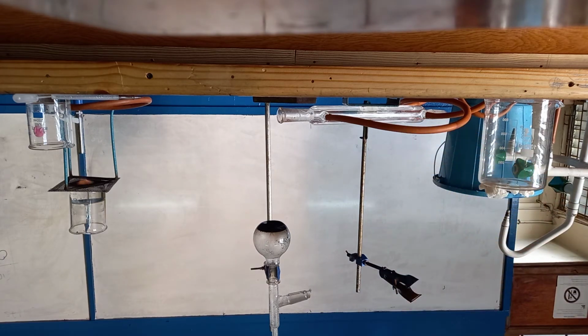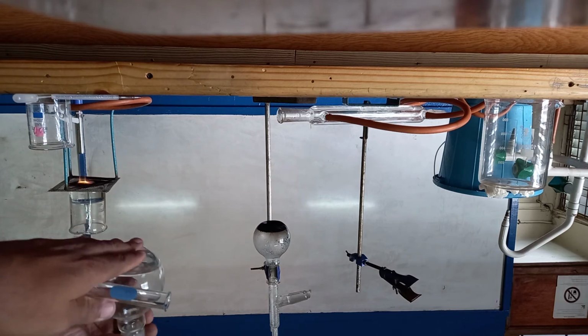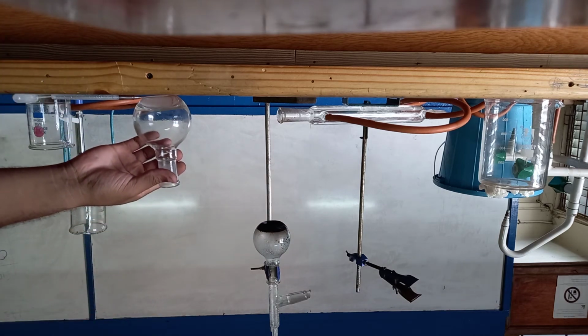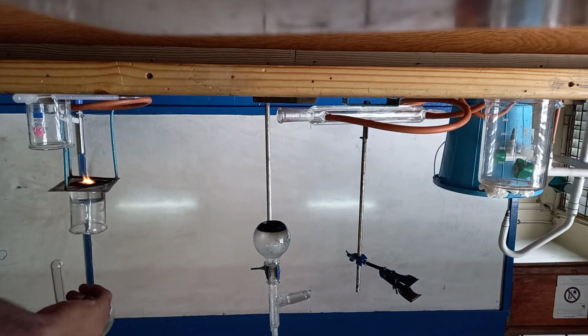So the next one is the Fehling's solution. This Fehling's solution was not working, but as I had explained, Fehling's solution has copper 2 ions, and so does Benedict's solution. So the reason why it is blue is because of our copper 2 ions. So I'm going to react it again with our aldehyde. I'm going to pour out a small amount because I need to use this for the reflux reaction. Just going to pour out a small amount because we need to oxidize the rest to the carboxylic acid.